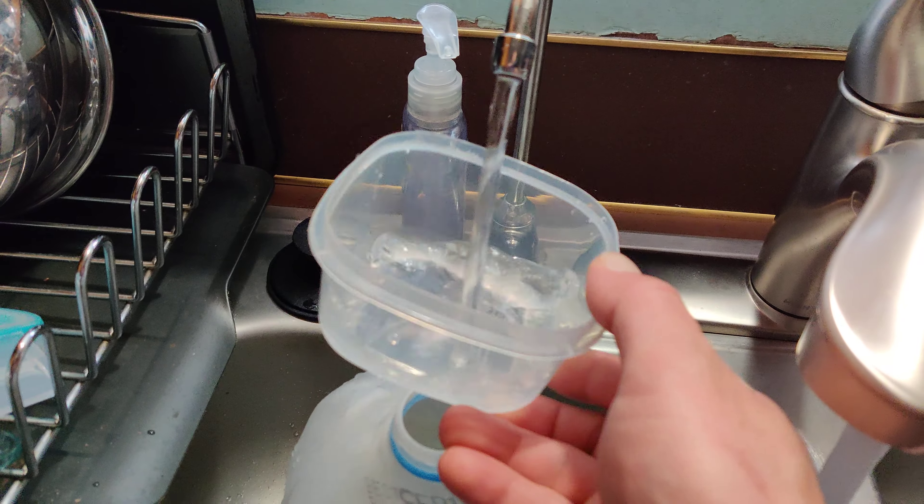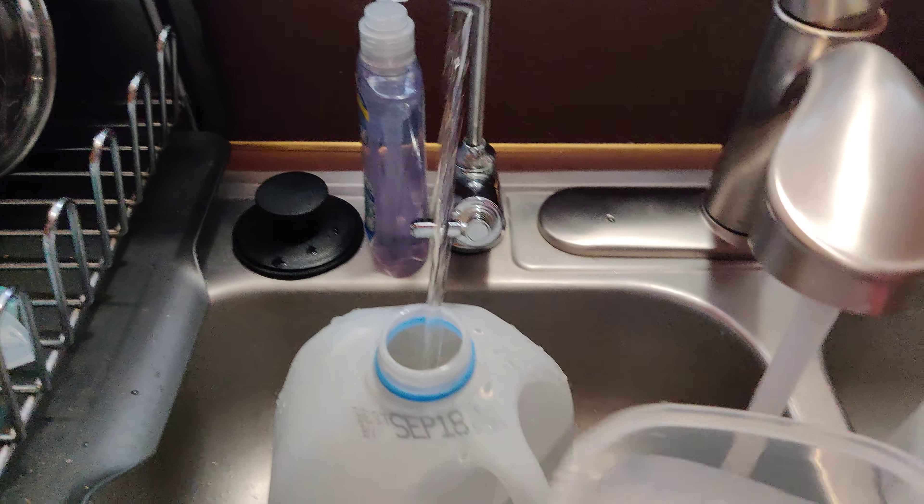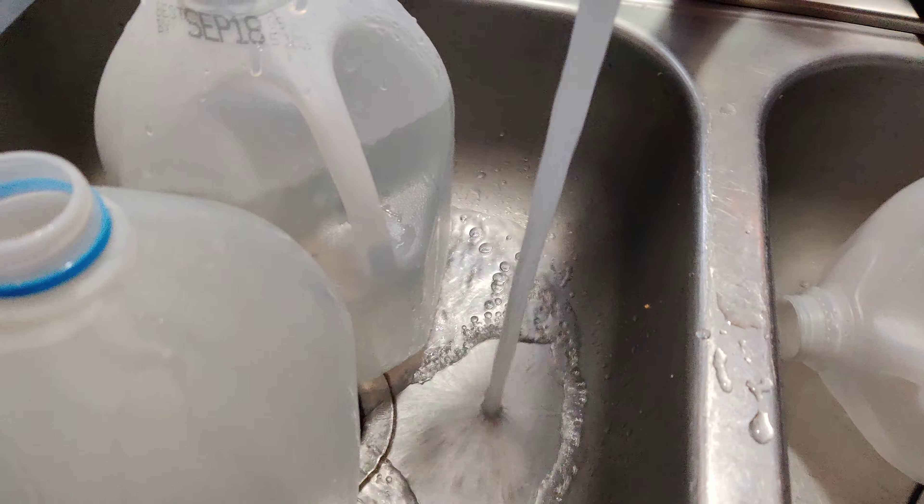Getting some filtered water. Let's see here — straight out of the tap. Set that over there. Get this little guy, go straight out of the water filter, fill up this guy. Sorry about the sound. For the pump to go through the water filter, we have to have the other one running too. Hence why I got water running in both.